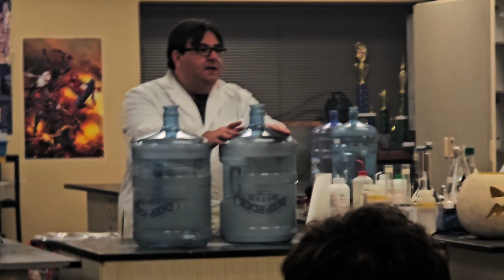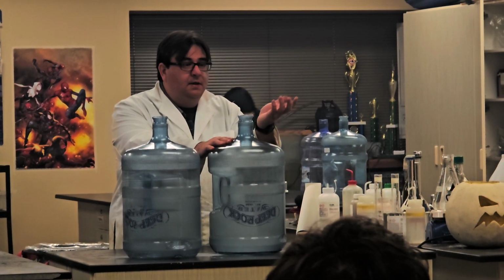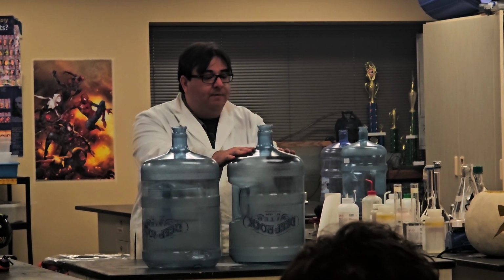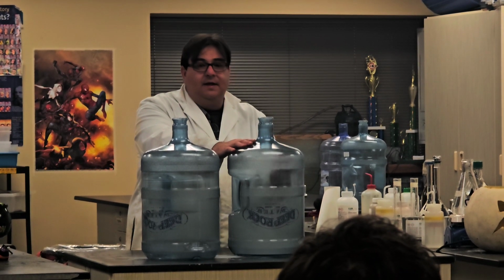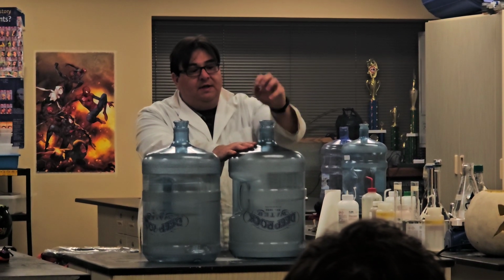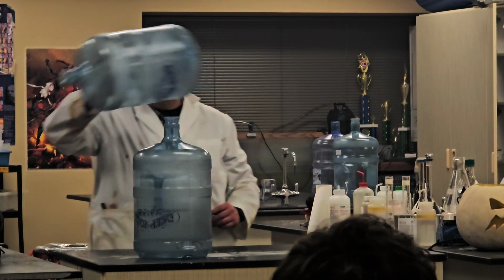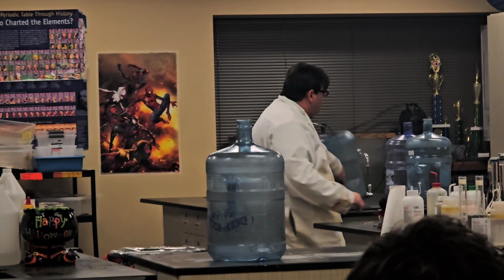And then the other product is water. So water is also something in here. Does fire like water? No. So that keeps everything out. So here we have a bottle that is now saturated with carbon dioxide and water. And the water actually acts like a candle. In between it, alcohol molecules are traveling between the water, coming to this opening where they react with the oxygen and are able to sustain a fire. You can see the undulation of the flame. The other thing is, the stuff I'm putting in here is just alcohol.